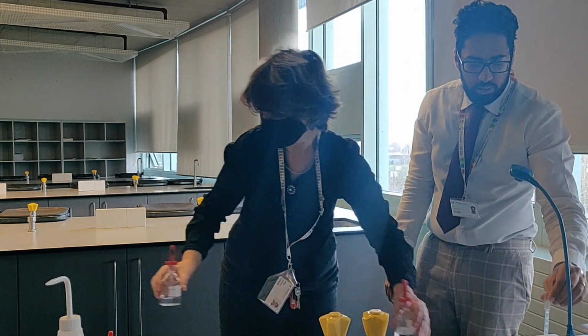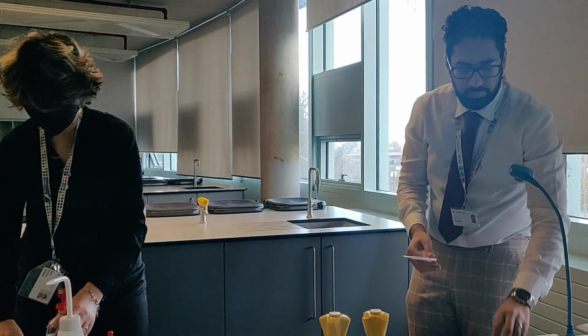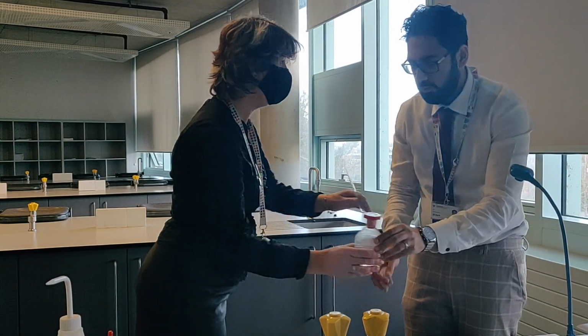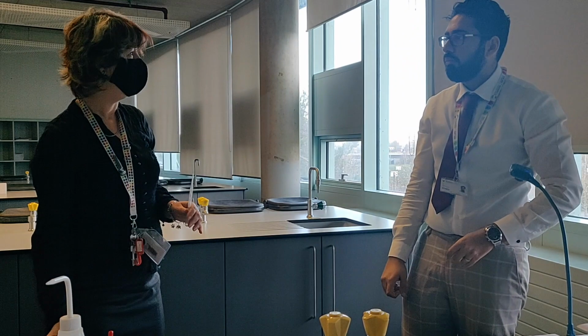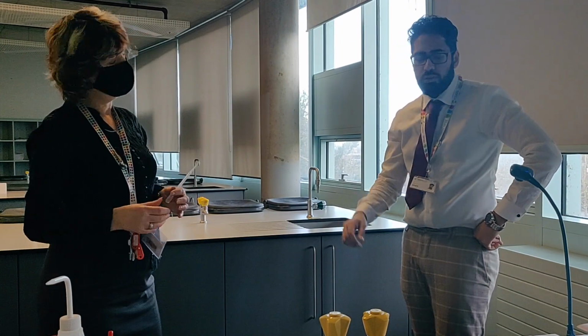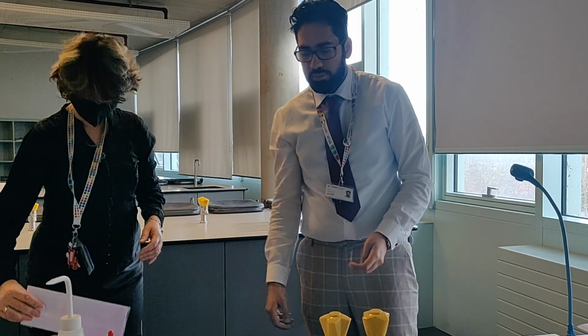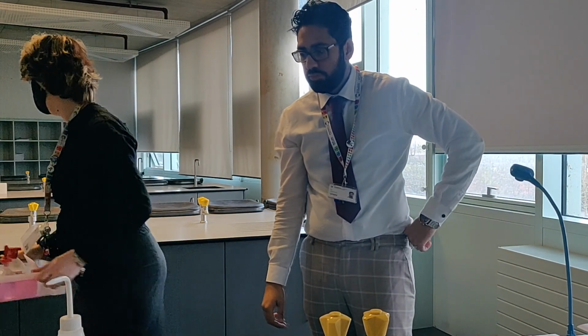Test 7 and 8, you will need to use the fume cupboard, and to probably talk a bit louder because the noise from the fume cupboard might be a problem. Yeah, that's fine. They wouldn't be able to do all 8 in 1 hour.